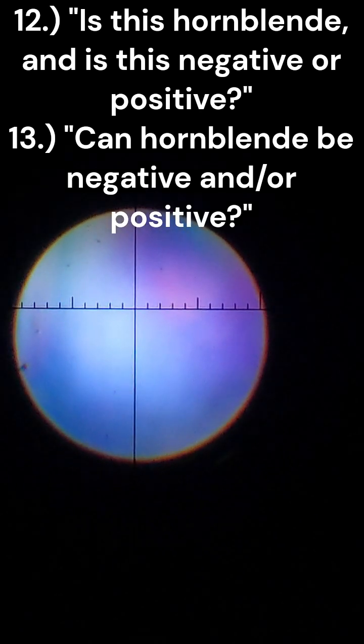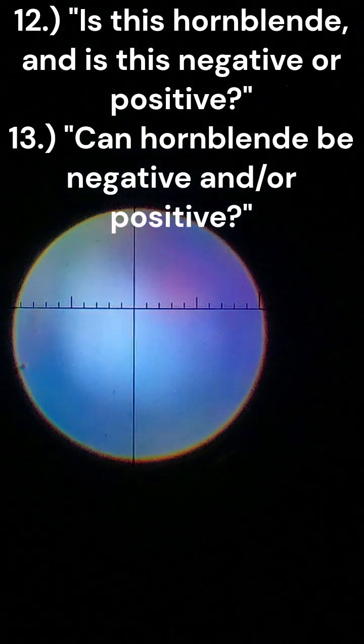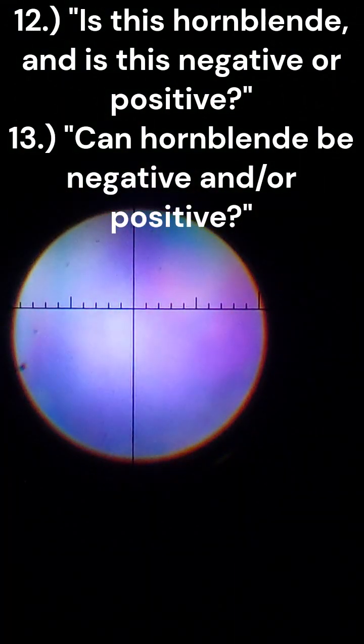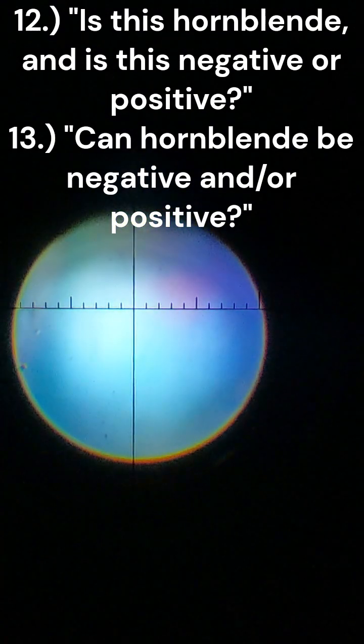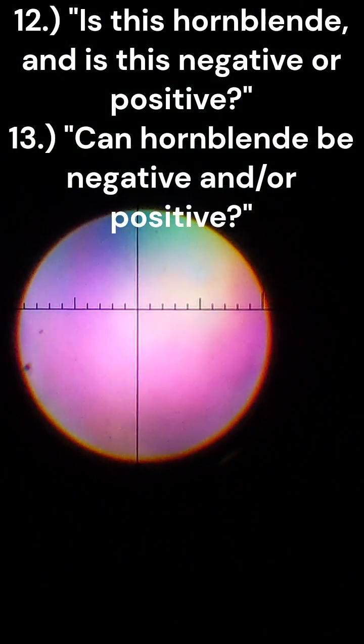Kinda nothing. Hard to tell. This looks to me like we have blue in the center and warmer colors are getting pulled up to the upper right. So, well, vice versa of that actually. I think this might be a negative, biaxial negative.